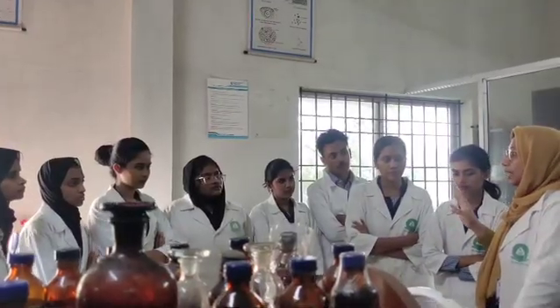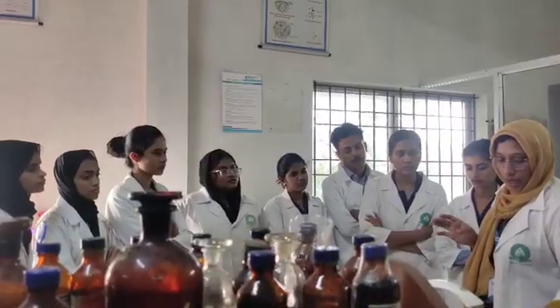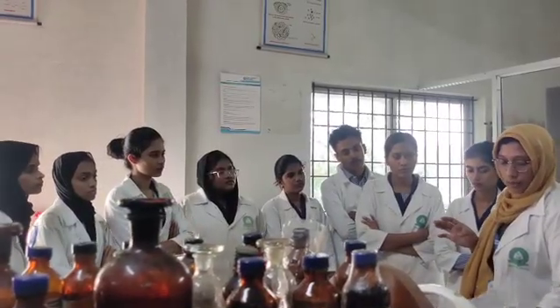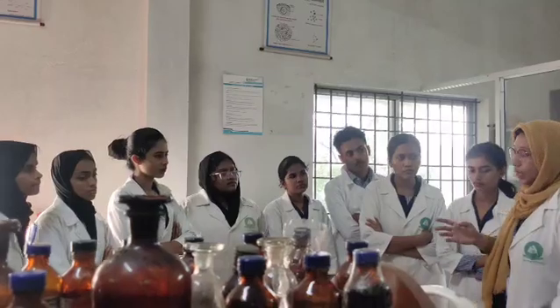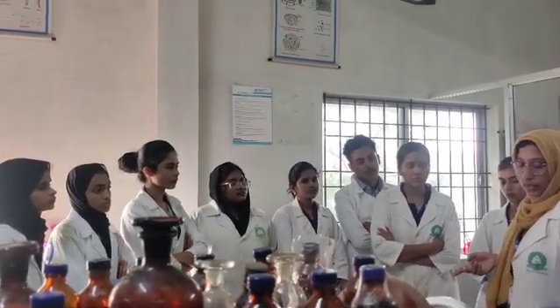So today we are going for 3 experiments. In total we have to complete 3 experiments. After that we have to go for chemical tests for starch and others. So today we are doing these 3 experiments.